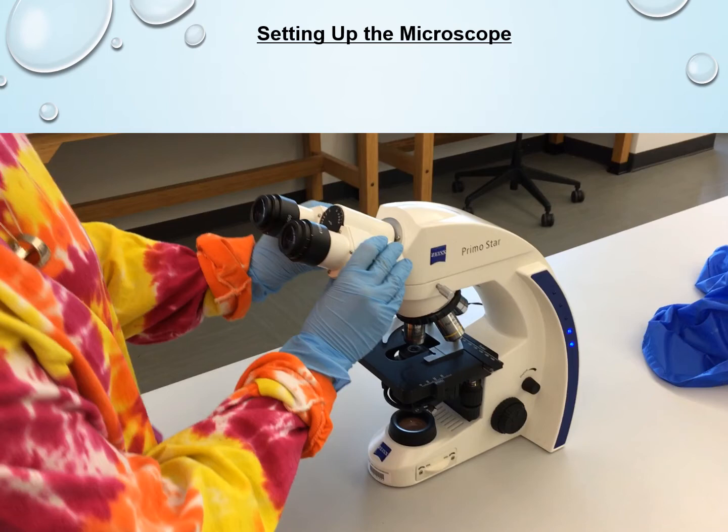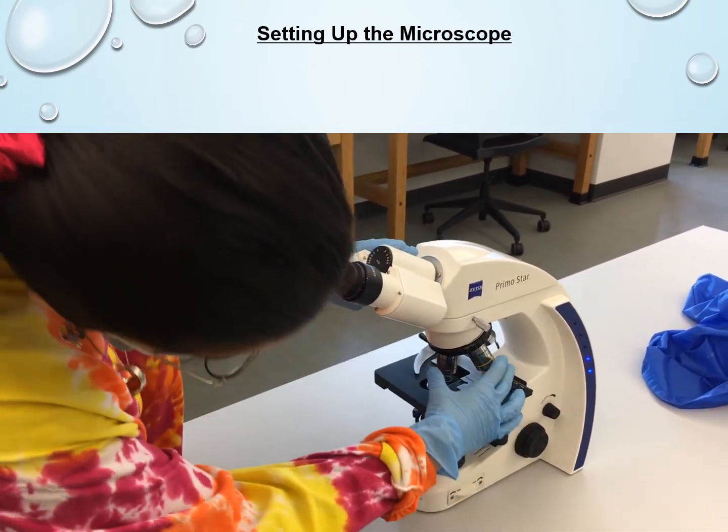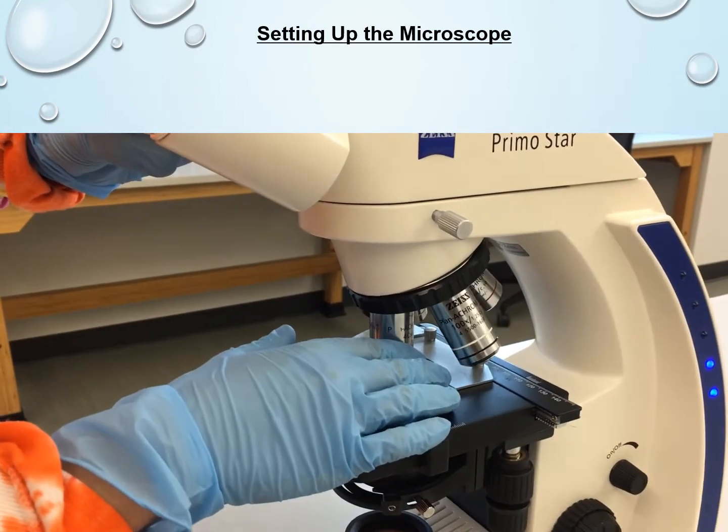You also see that right now Emily is holding the eyepiece in her hands. So that's the piece you would actually look through, and that adds on 10 times magnification to your total magnification. So make sure you don't forget to include the eyepiece magnification when you're calculating the total magnification of the microscope. And the eyepiece can actually be adjusted for the width of your eyes. That's important. Now Emily is flipping through the objectives.